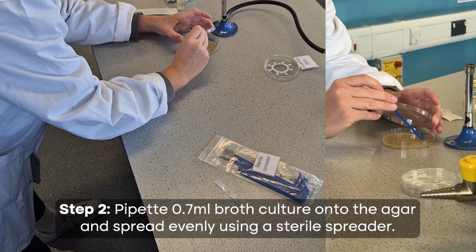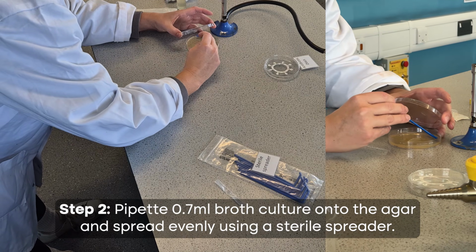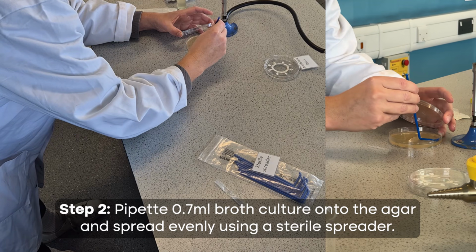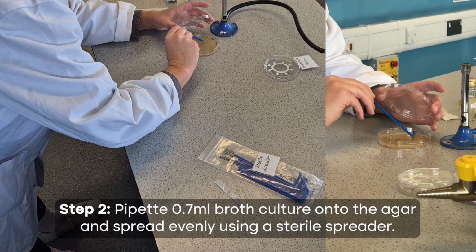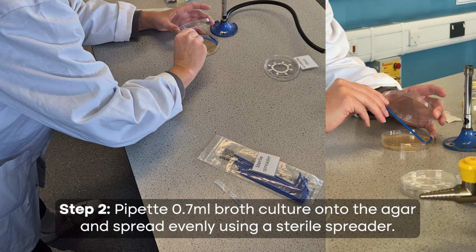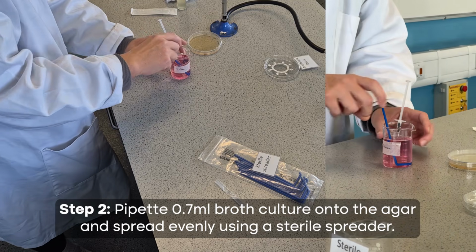You need to make sure you're spreading it all over the plate. And it's hard for students to do this because it is all colourless, so you can't actually see for definite, and you'd want to try and not add in microbes. So I tend to just go around it almost like a clock face, just to make sure we're definitely getting all the way to the edge of the agar plate. And then immediately the spreader is going into the Virkon.